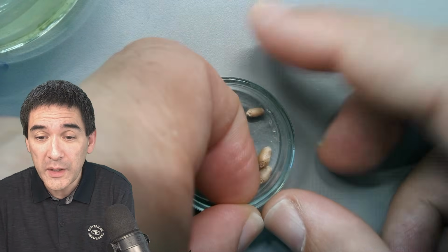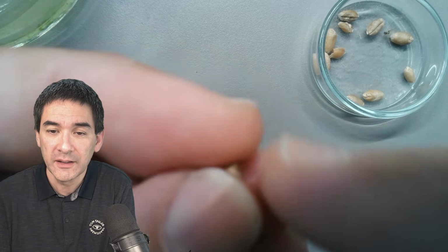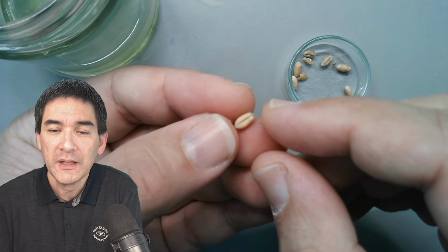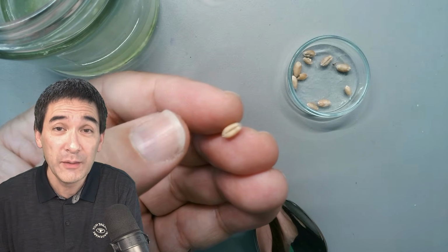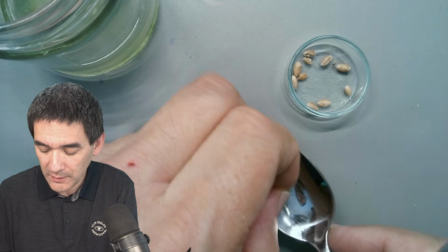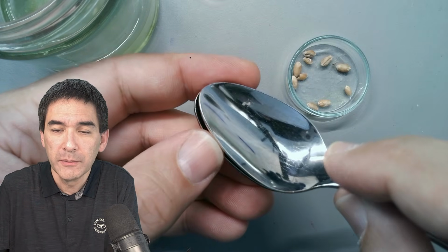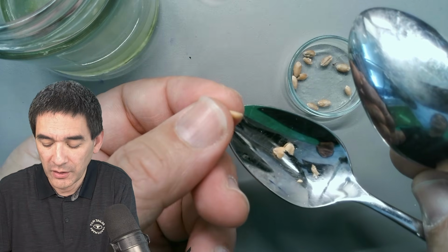You take a wheat grain. I recommend wheat grains and not polished rice because they're simply easier to handle. Every time I have to adjust the focus a little bit here. Those wheat grains will serve as a food source for bacteria, which are also present in the water sample. And then the ciliates, which are much larger, will feed on the bacteria. What you should do is take a wheat grain, put it on a spoon, take a second spoon, and simply crush it, boom. That's pretty much it. Those crushed pieces, you just drop them into the water sample.